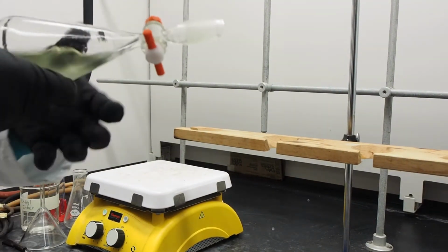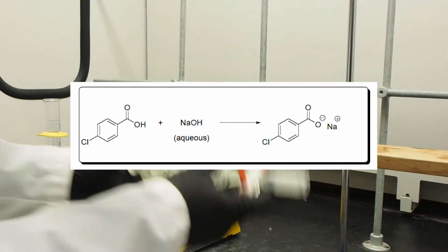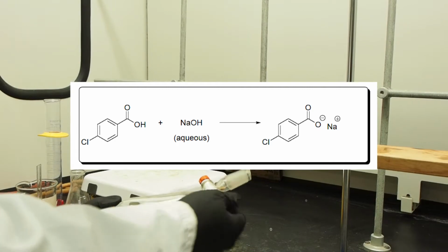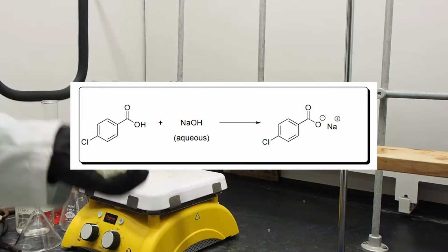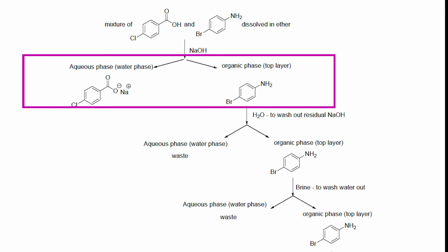The acid-base principle behind this is as follows. 4-chlorobenzoic acid, being water-insoluble, reacts with the aqueous base, sodium hydroxide, and is converted into a water-soluble salt. Thus, it is being transferred from the organic phase to the aqueous layer, while 4-bromoaniline, being a base, does not react with sodium hydroxide and remains in the organic layer.